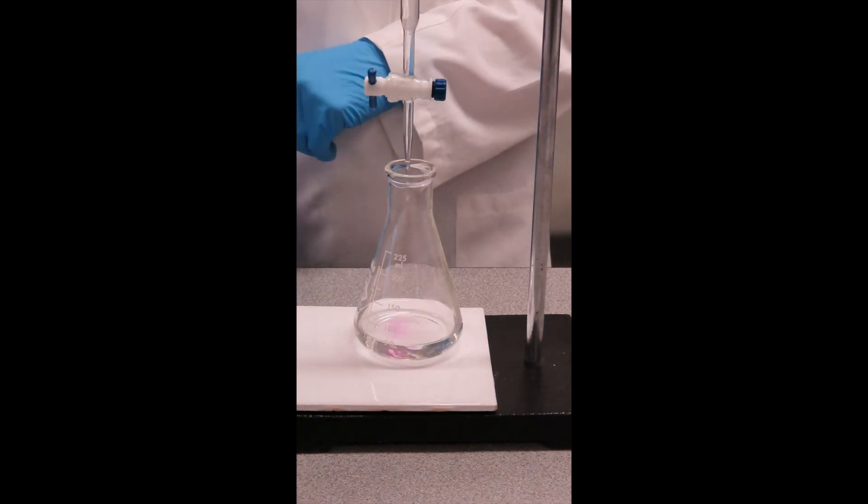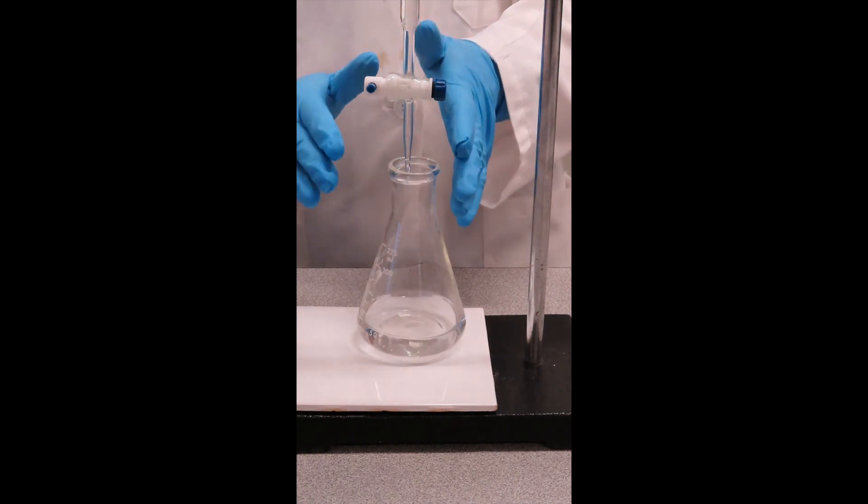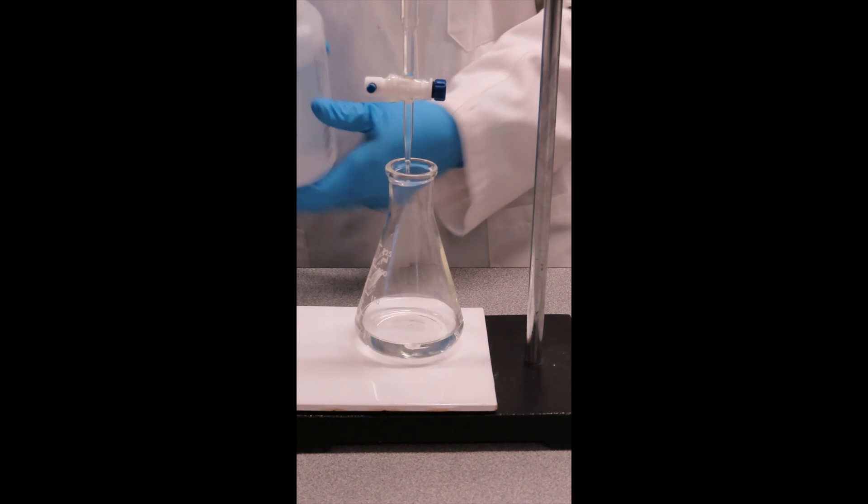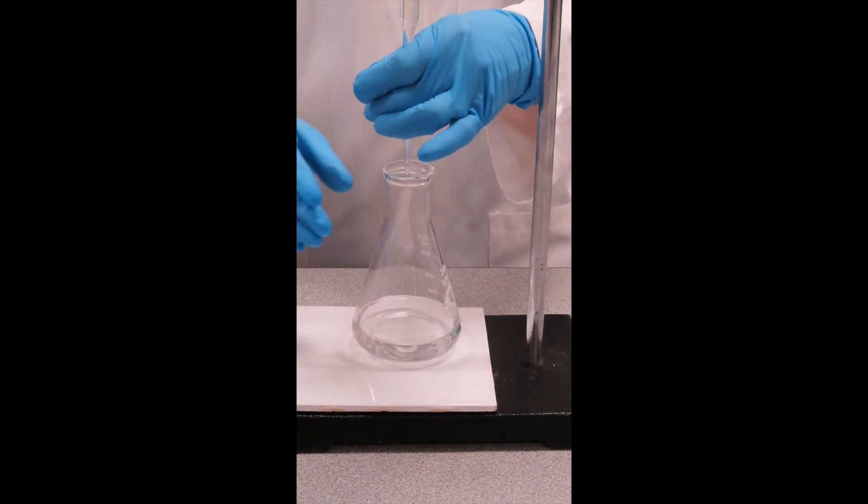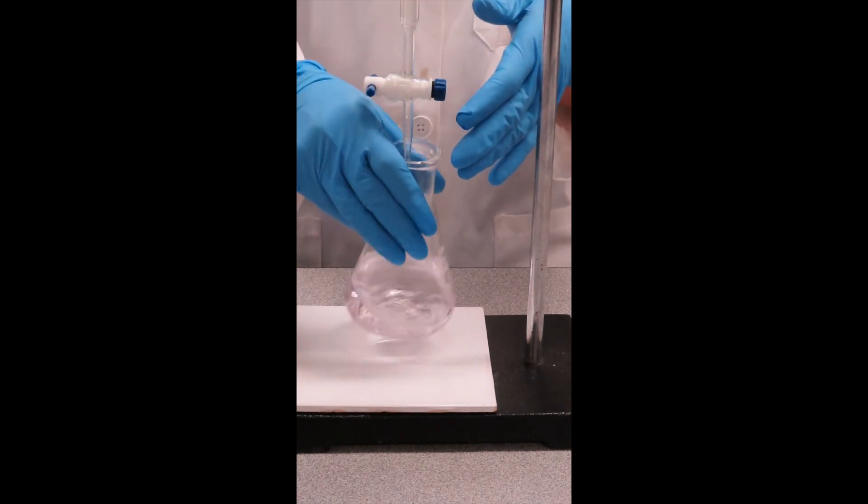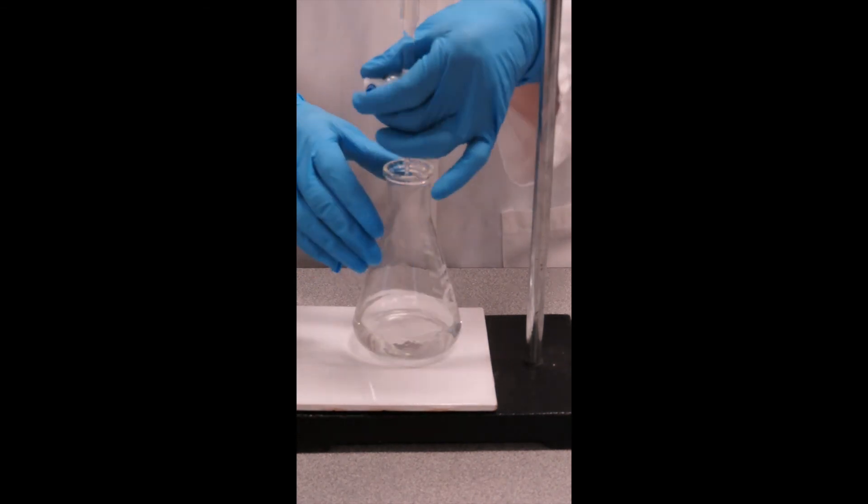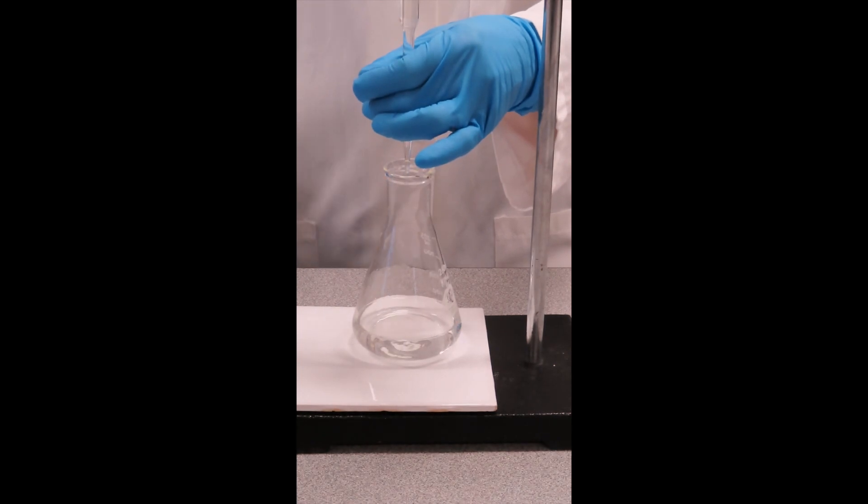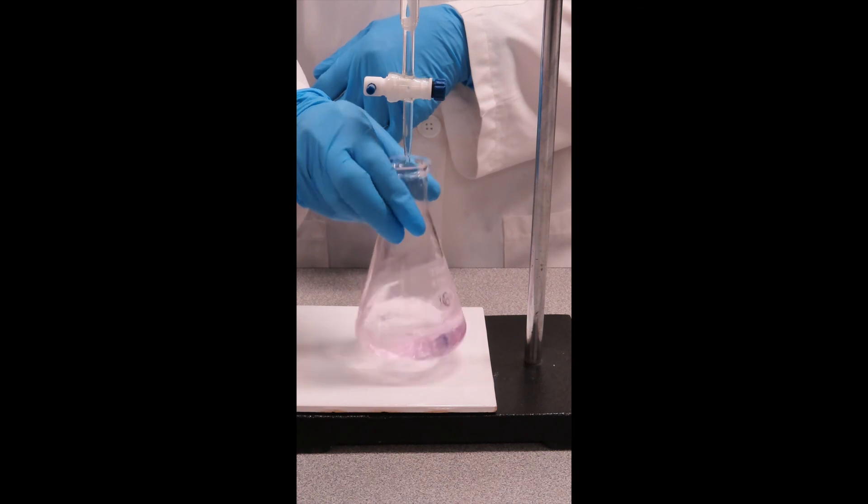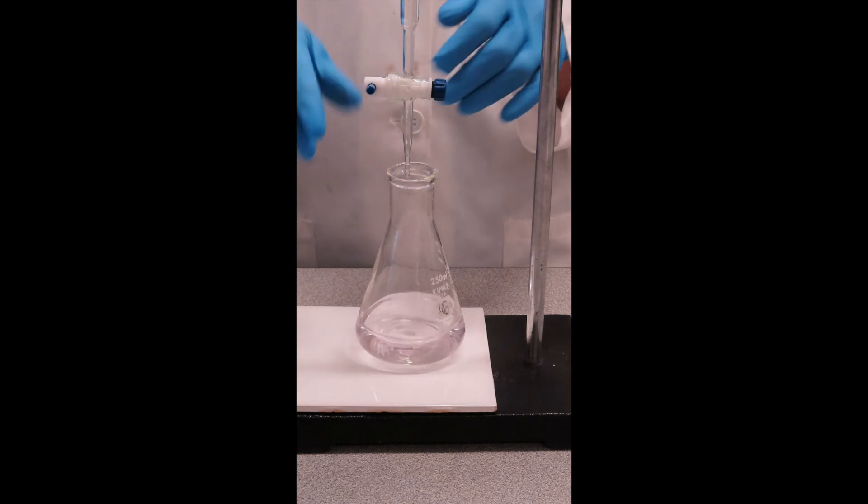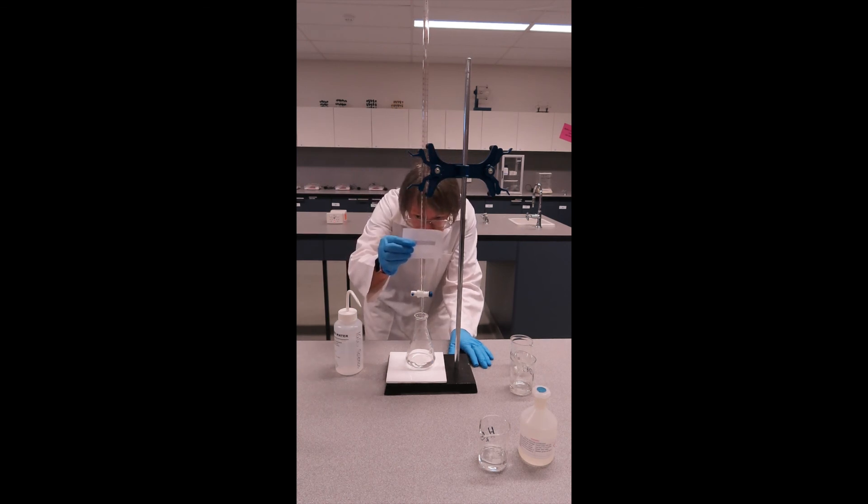At the moment I'm delivering one drop at a time. Now that end point was good but it faded too quickly. Rinsing everything down. Again, not quite the 10 seconds. Again, that was the end point we want. Taking a final reading, I have 44.40.